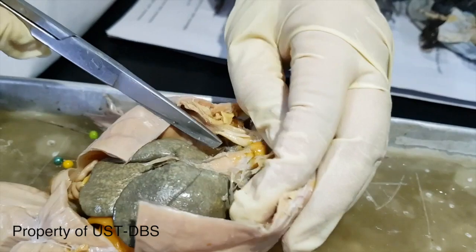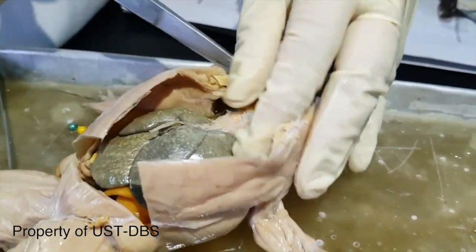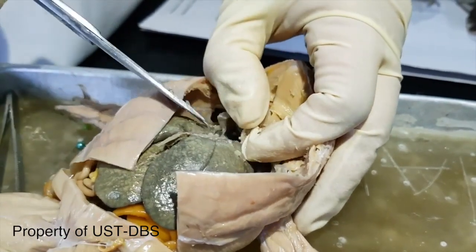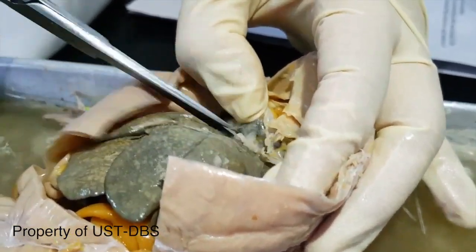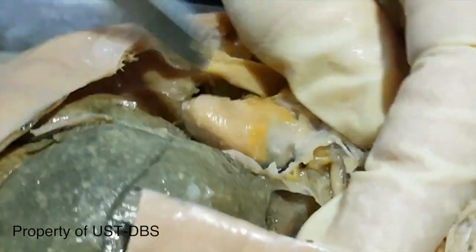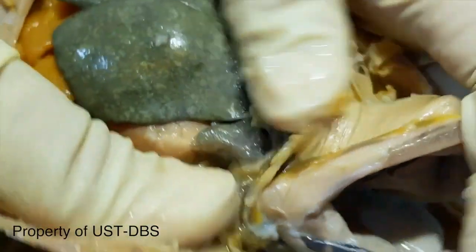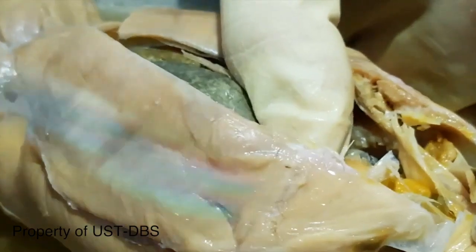Seen here, you would see some fats, visceral fat that covers part of the heart. I'm going to remove this.